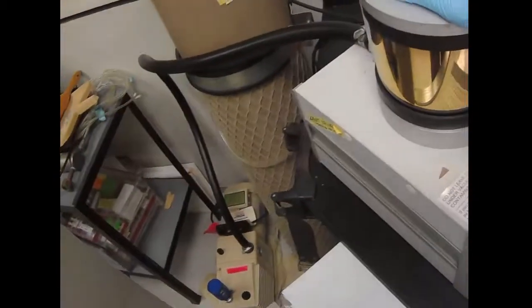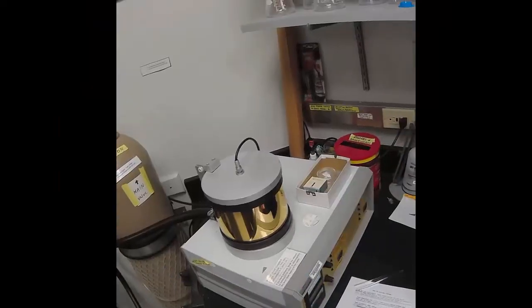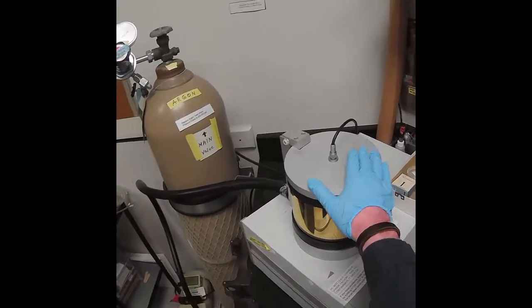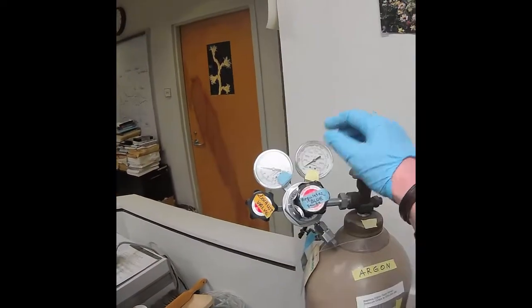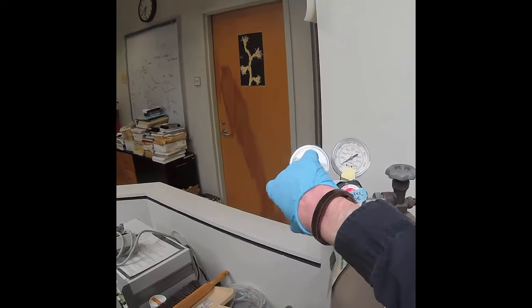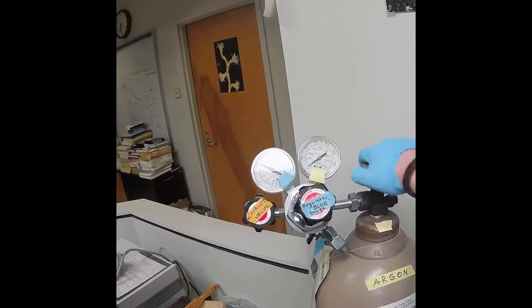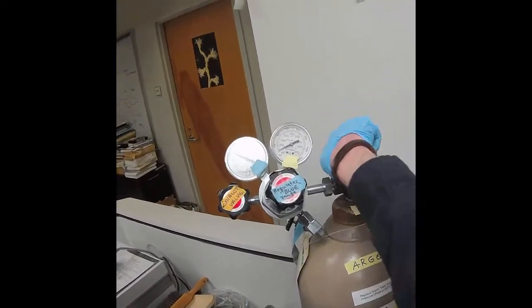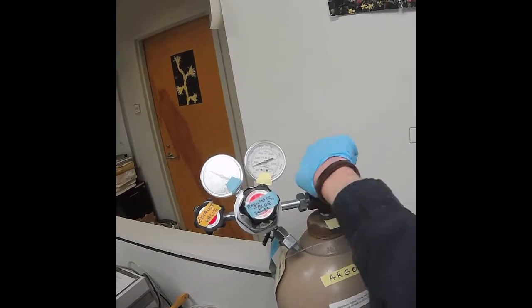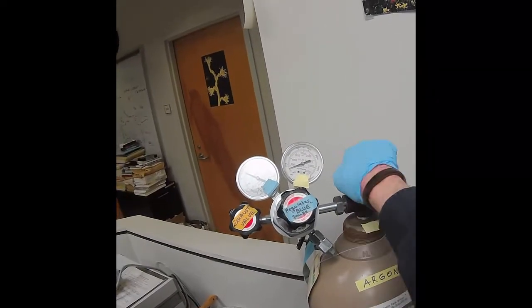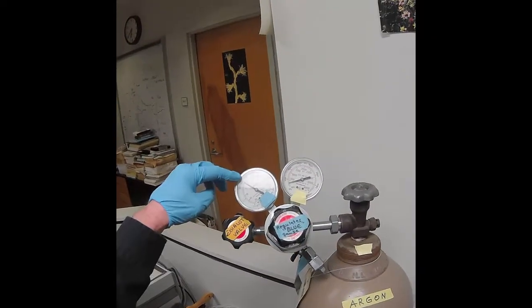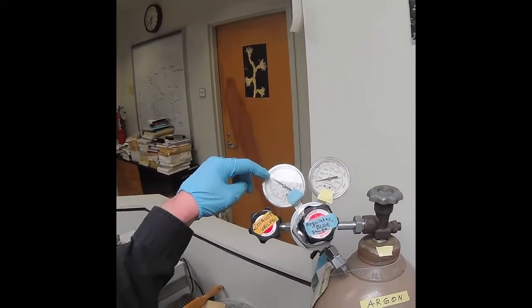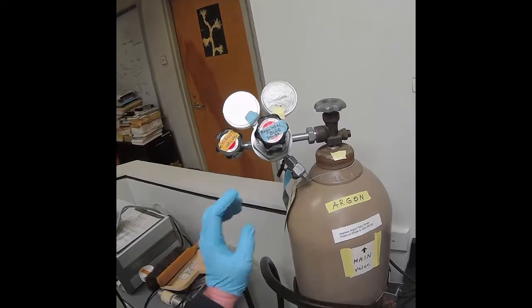Then we're going to apply a vacuum, so we need to turn this on. Once you've placed the sample in the chamber, make sure it's closed well. Turn on the power switch. Turn on the argon, make sure the exhaust valve is closed. You want to have at least 200 psi. This should be at 4 psi, so don't touch that.